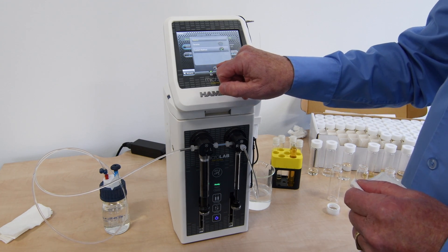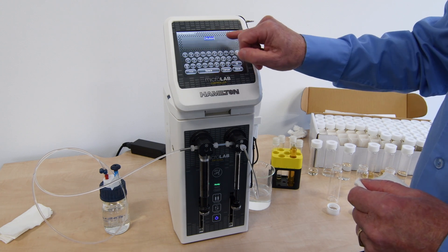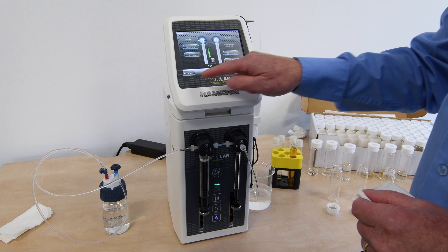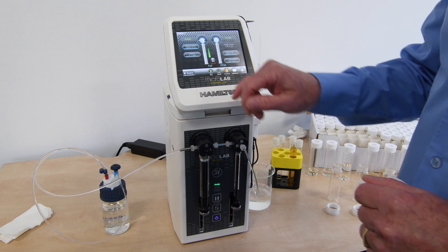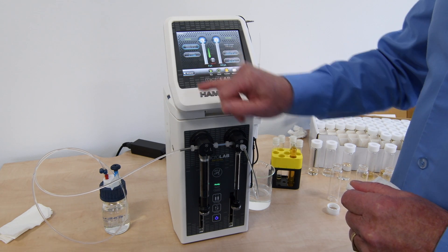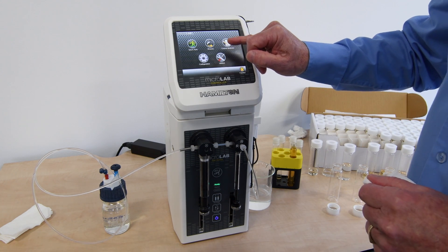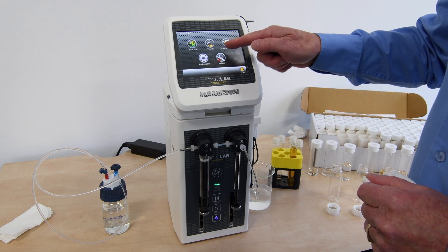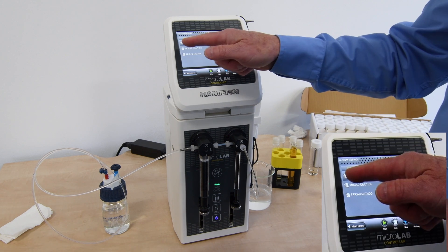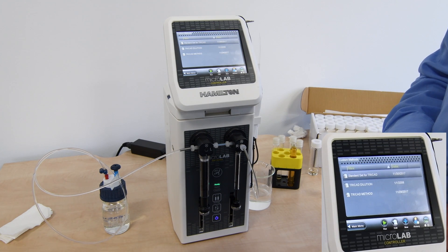I'm going to go back into accepting this — you'll see there would be a means of actually giving this a name. We're going to cancel this, and I'll do one I've prepared earlier. Going back from our wizards onto our main menu, we have custom methods. Here we can see this was a standard set for the TriCAD reference material standard.